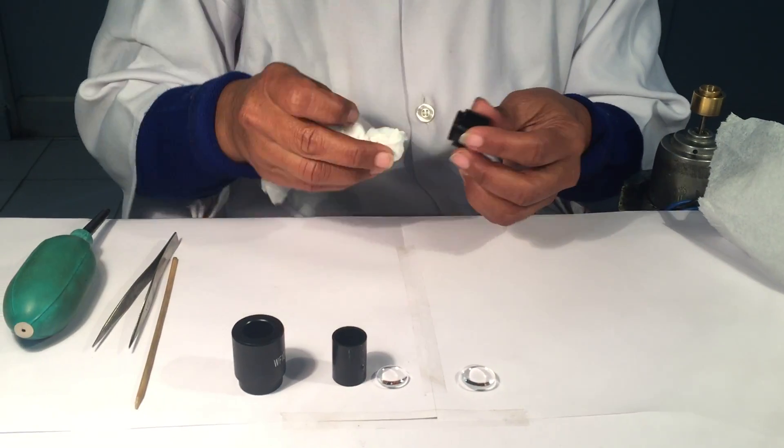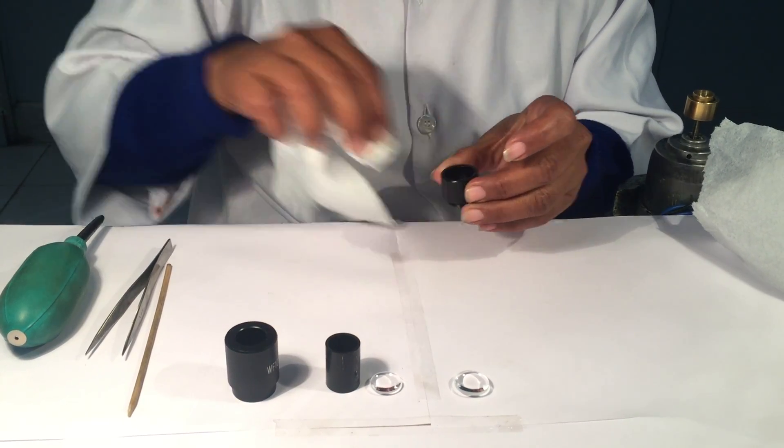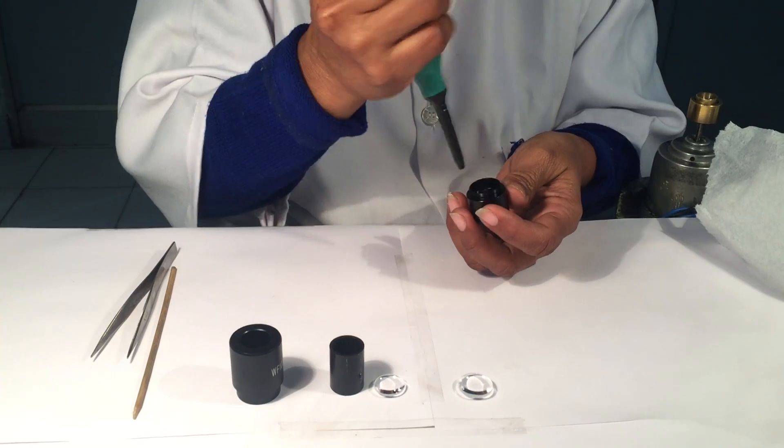Then we will take the lower part, similar process and air blow the same from inside.